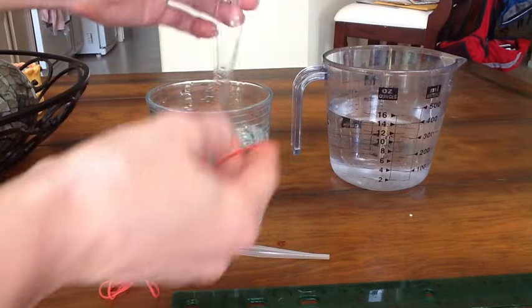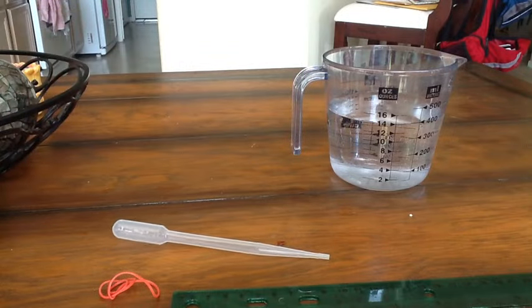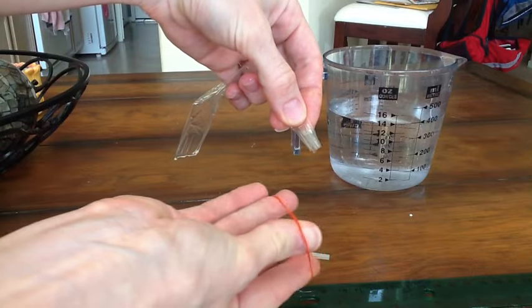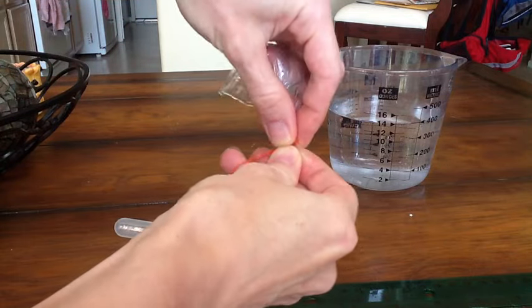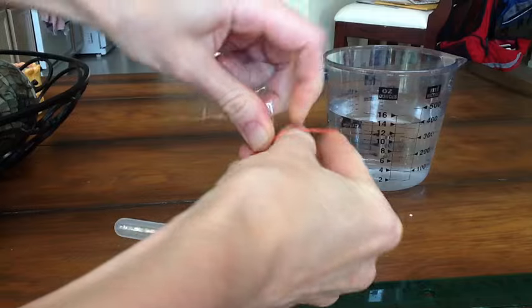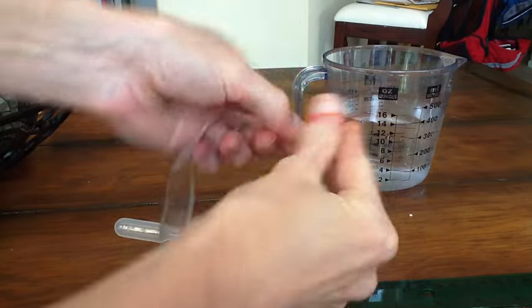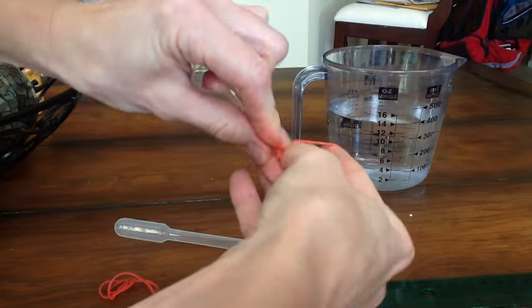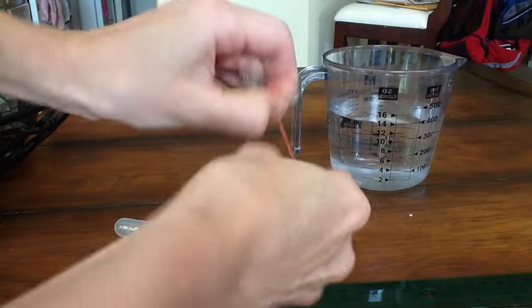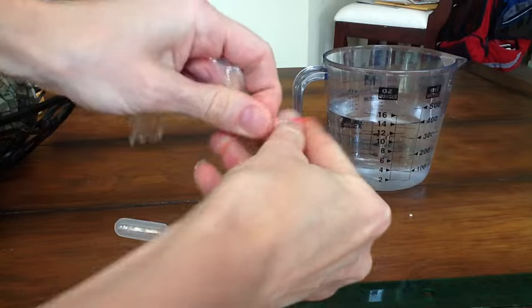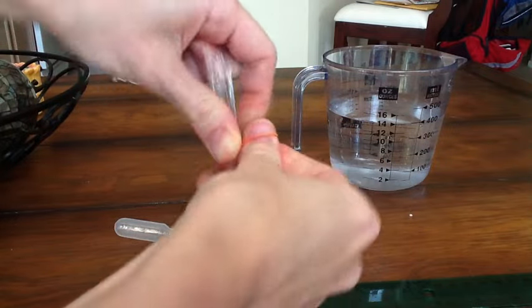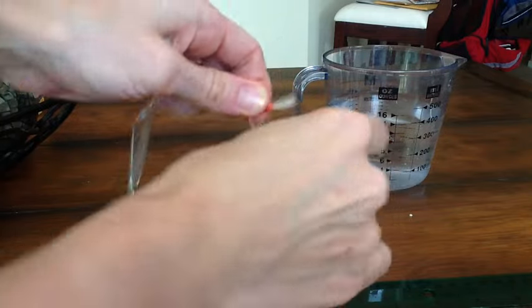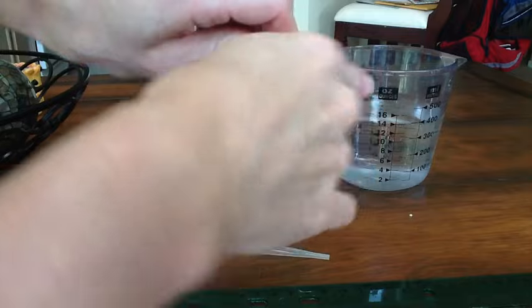So what I'm going to do is after I've separated this all out, I'm going to take the edge of the baggie and one of these really thin rubber bands, put it around and just make a very very tight seal here at the end so that when I fill this up with solution none of it's going to escape out of the end of this dialysis bag.